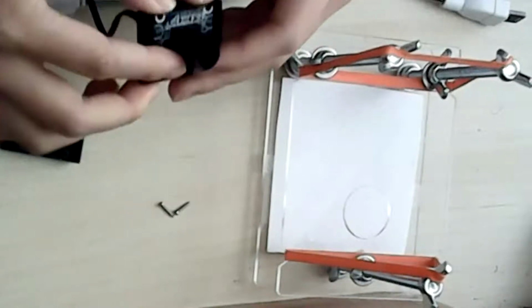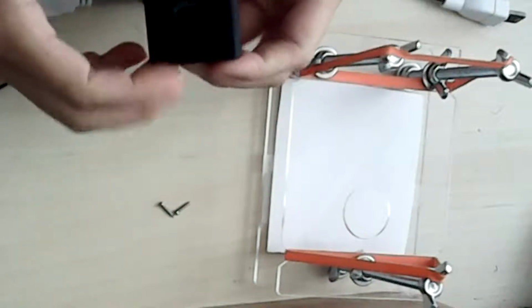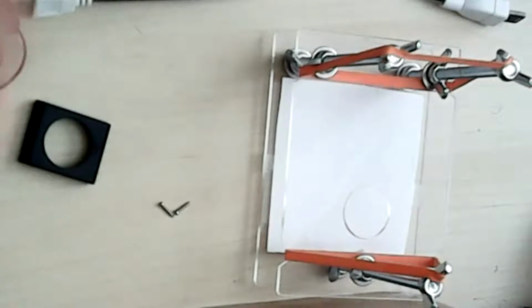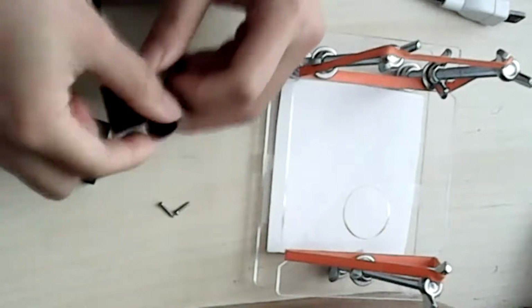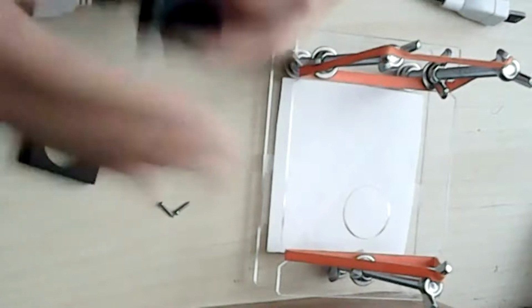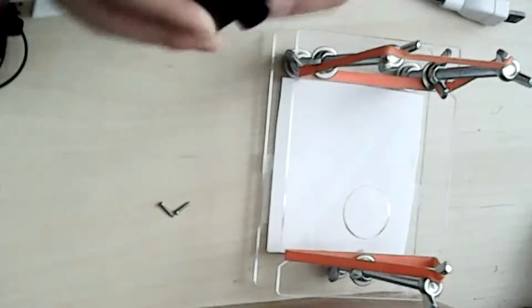Can I ask a question? Are you recommending to do a little bit of focusing while you have the camera just in your hand like that before you place it on the stage? Yeah, it's a little bit easier to focus now before you place it on the stage, but you can definitely place it and then figure out by trial and error if you need it to be closer or further away. But I do recommend doing a little bit of focusing here. So unscrewing it around twice will get you pretty close. I found the more you unscrew, the closer you can get to your specimen. Cool. Yeah, I've already turned it around 2 times. Okay, thank you.